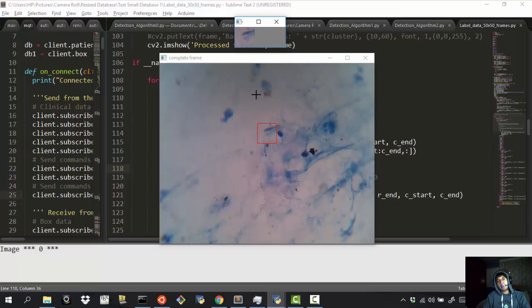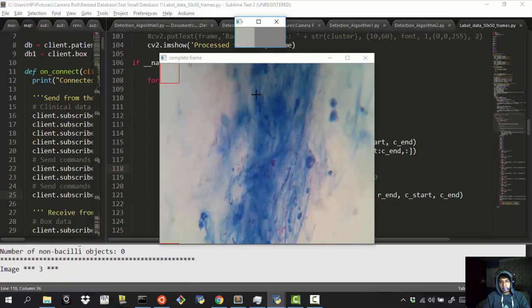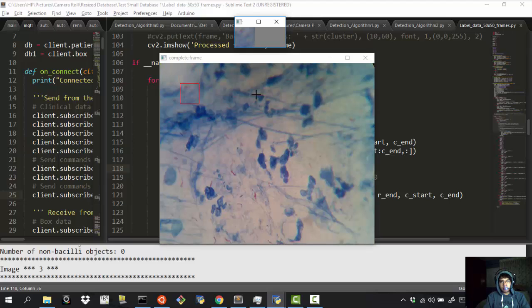I have made some commands with the keyboard so that I can move freely around the image and classify. I have also set some commands to resize the window, so I can resize it to be a 12 times 12 frame, a 25 times 25 frame, and a 50 times 50 frame. Okay, so we're just going to take this analysis, but with this image. Actually, the previous one was better, but we can do the same with this.